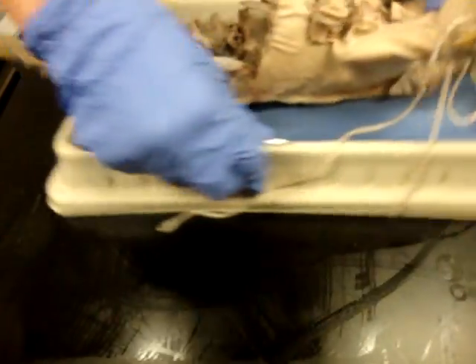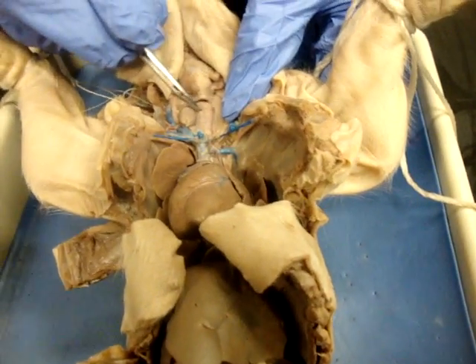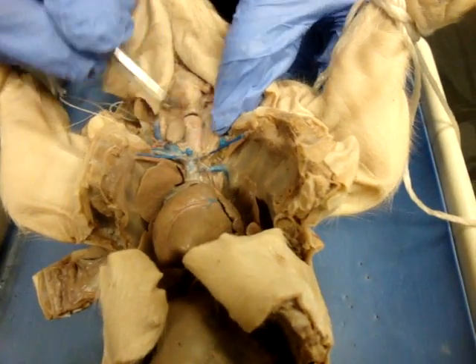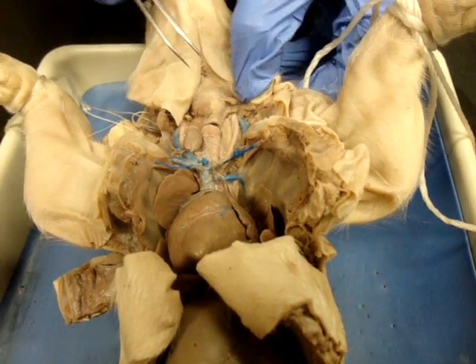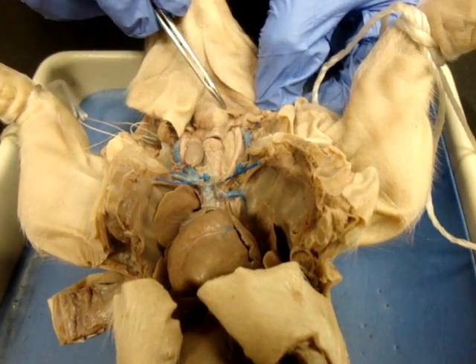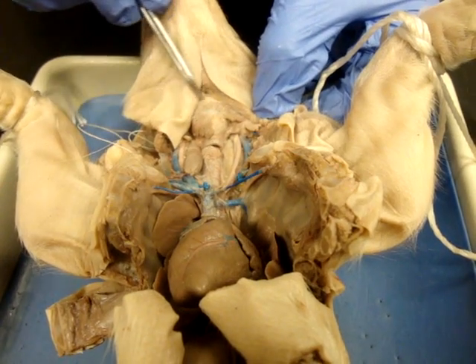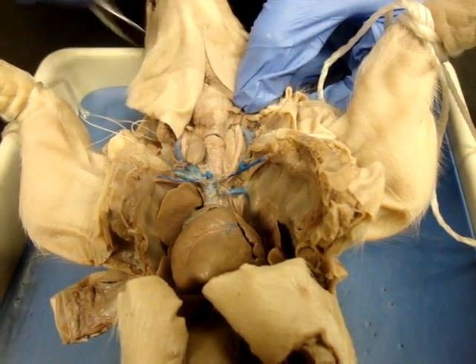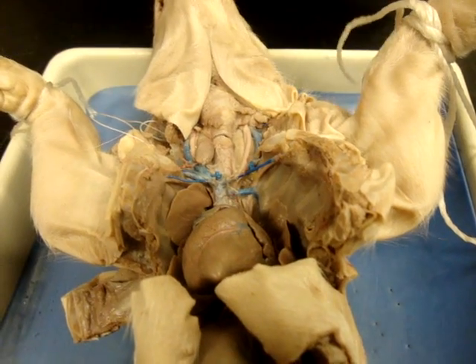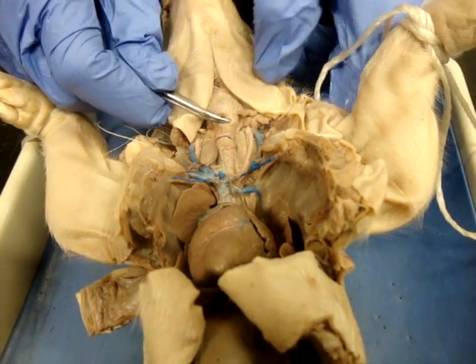If we take a look at the neck region, this group had cut open part of the neck region, but you can see where it would be connected otherwise. First we'll do the larynx. The larynx is the voice box, so this is going to be the larger unit up here. It's got a little bit of a harder structure to it. This is equivalent to our voice box or Adam's apple, so it extends out.